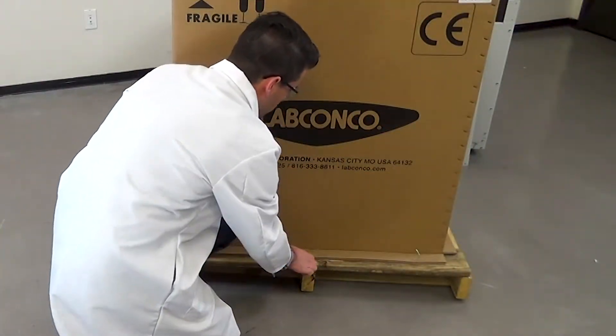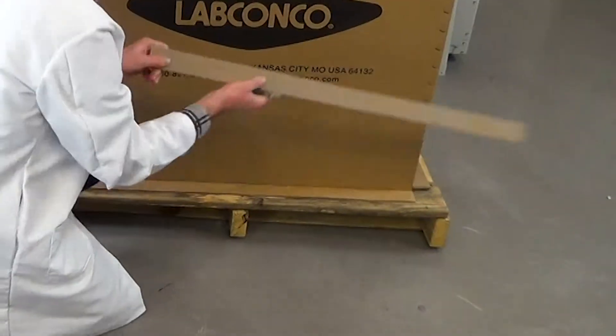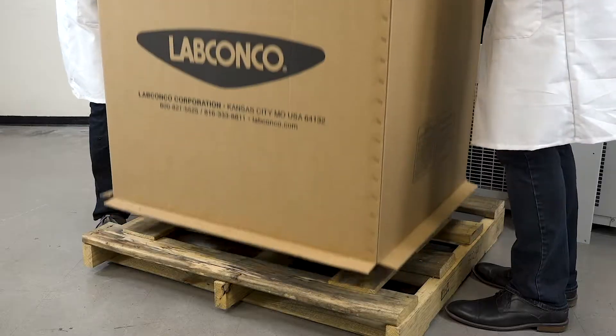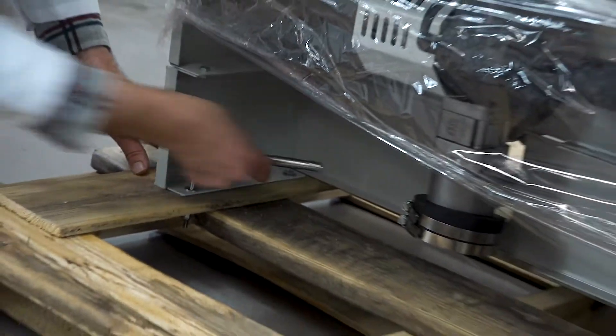Upon delivery, thoroughly inspect the FreeZone packaging to ensure that damage didn't occur during shipping. Don't discard the carton and packaging material until you've successfully installed and tested your freeze dryer.